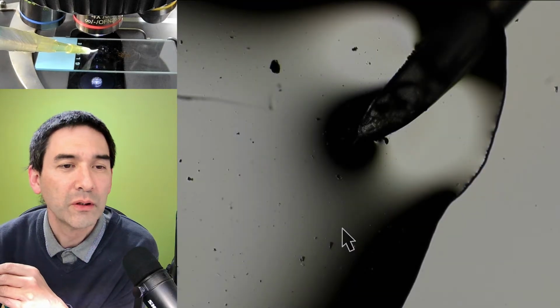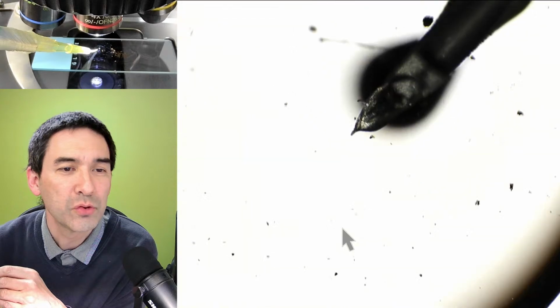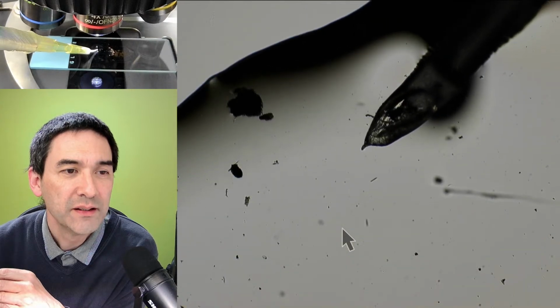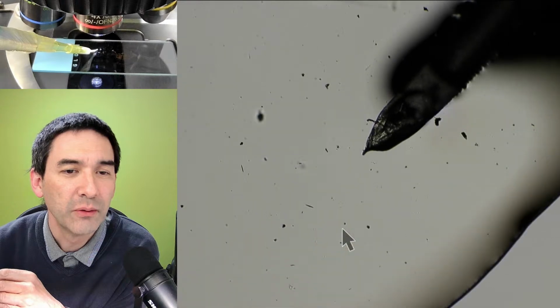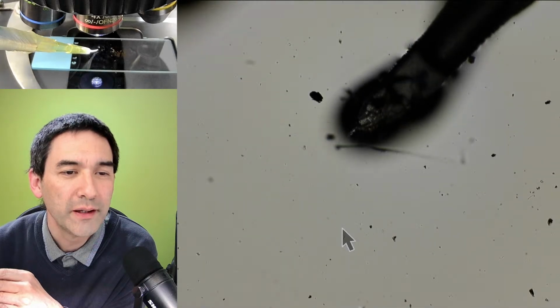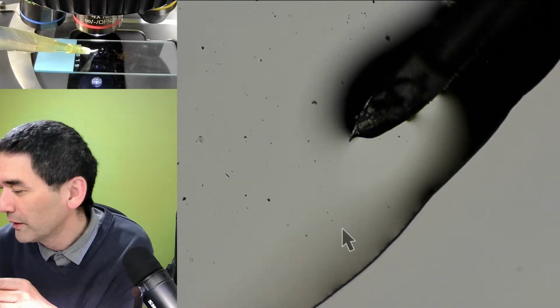Go down to a lower magnification, and I don't know if I actually caught it or if I was able to transfer it or not. But then I'll show you how I've made this thing. This is a little bit of a proof of concept, okay? Maybe I didn't suck it in. I'd have to try again. But you get the idea, right?